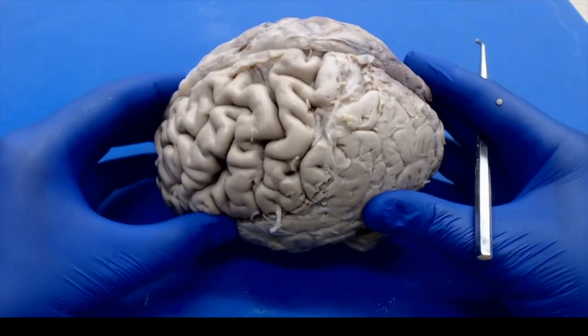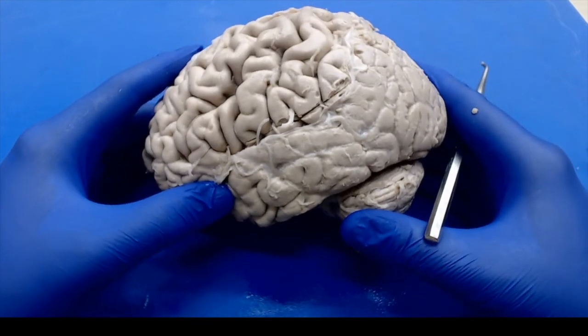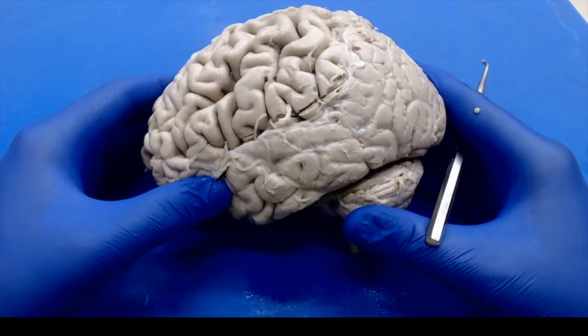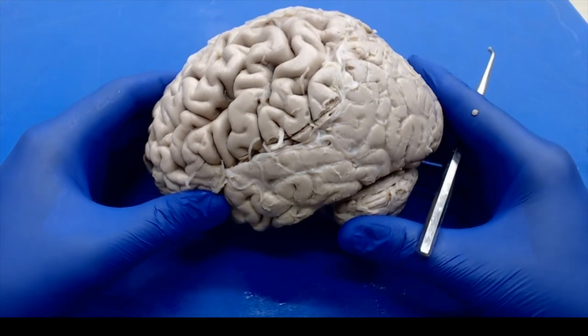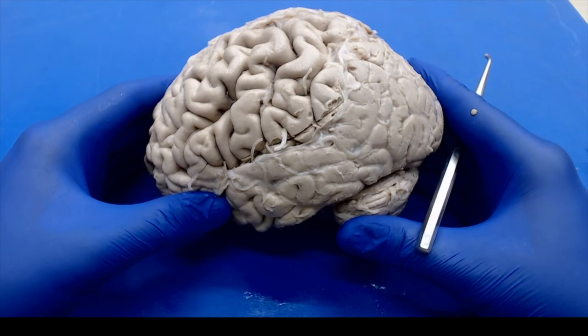Okay, today we will be looking at the brain, going over some basic neuroanatomy, and then demonstrating how to properly do some brain cutting when you get these in autopsy. Every place will be slightly different, but if you have a basic understanding of what you need to look for and why, you'll be better equipped to handle brain cutting and autopsy dissection.